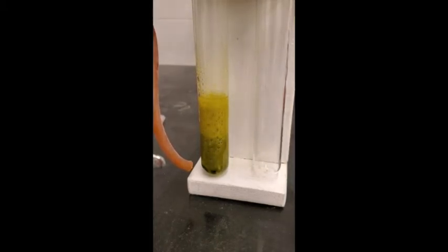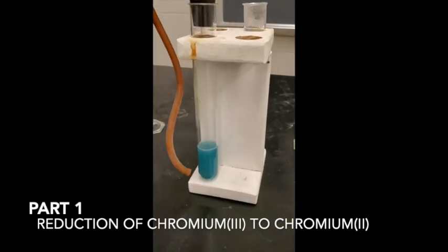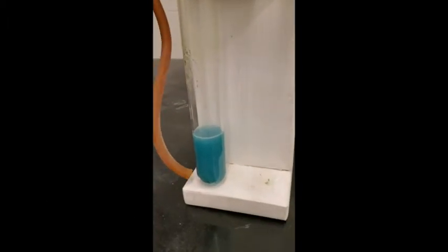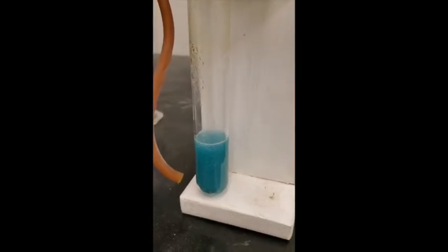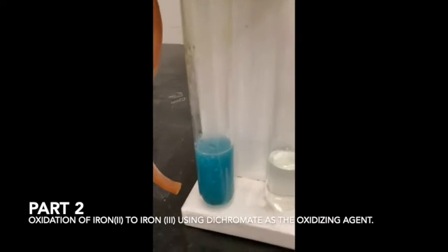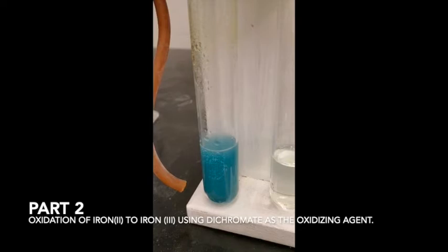Once we lose all the orange color and you see the green, then we're going to do another experiment, because the second reduction from the chromium 3 to chromium 2 takes longer. And I'll wait till it happens to show you how beautiful that chromium 2 is. It's really pretty. It's starting to turn a little blue now. You see it's getting bluer now. When it gets finally to chromium 2, it'll be kind of a sky blue color.